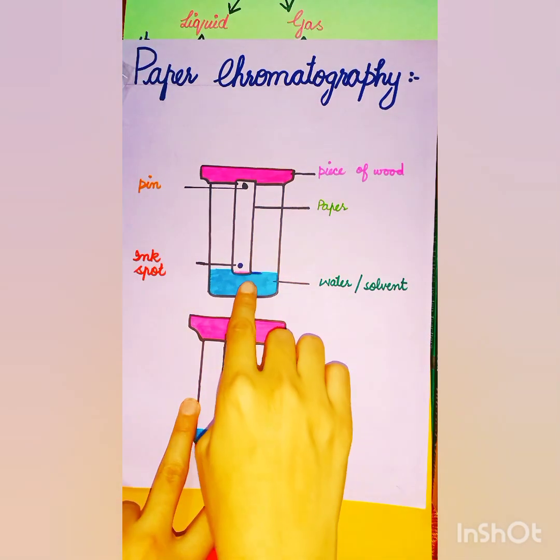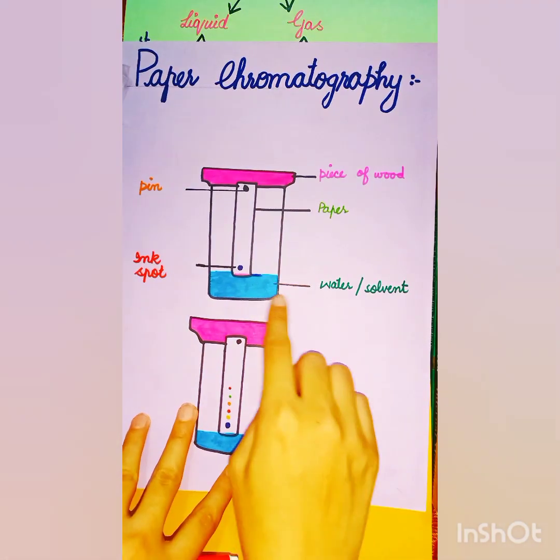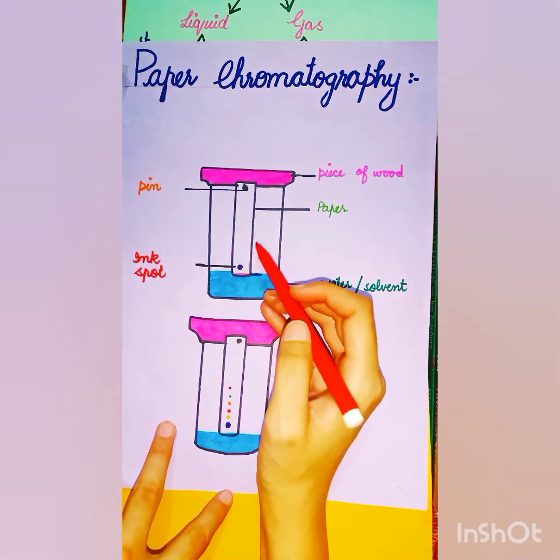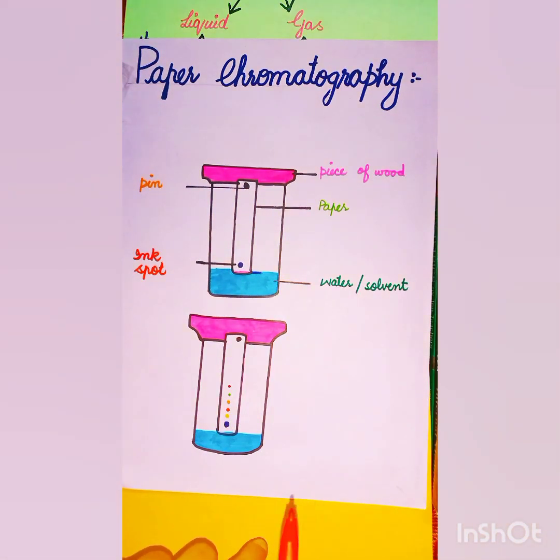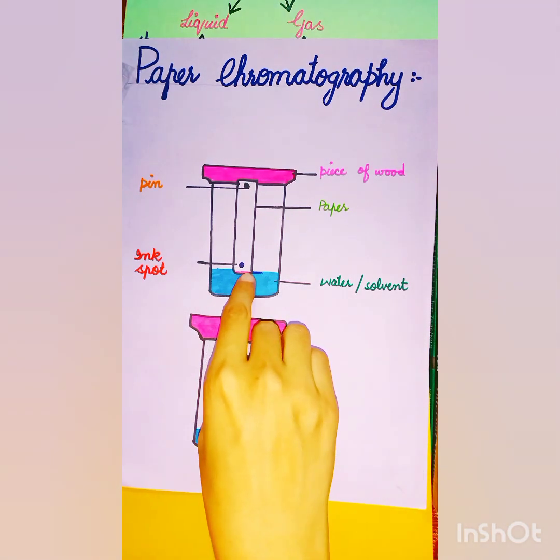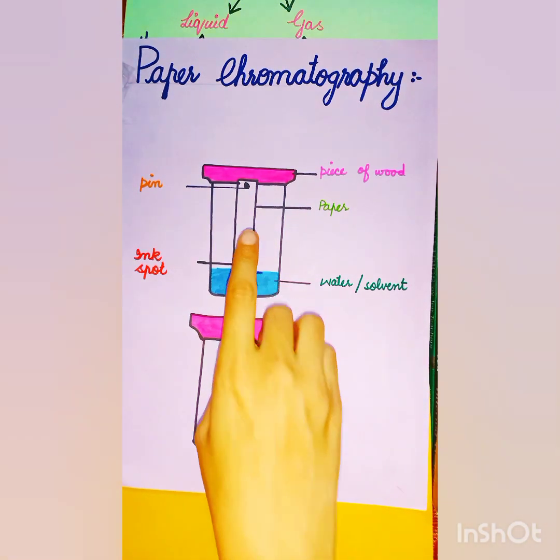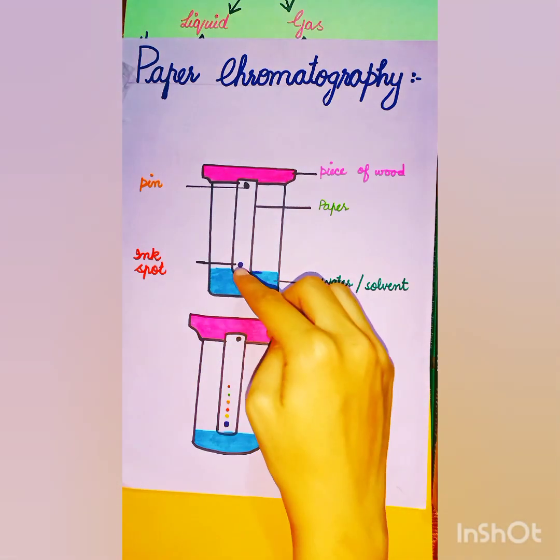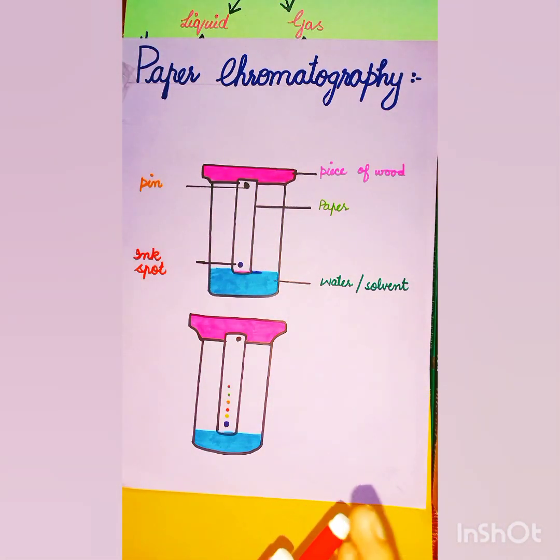After the ink spot dries, we start the process. We dip the filter paper about 1 cm into the water or solvent — just a little bit at the corner. The water will rise slowly through the filter paper by the action of capillary action. When the water rises, the ink spot will also rise and its components will spread out and be shown separately.